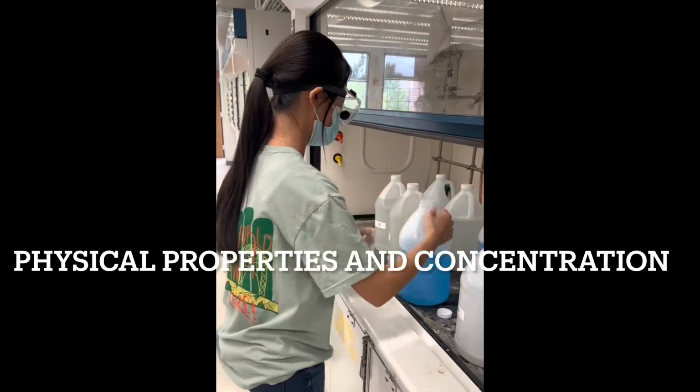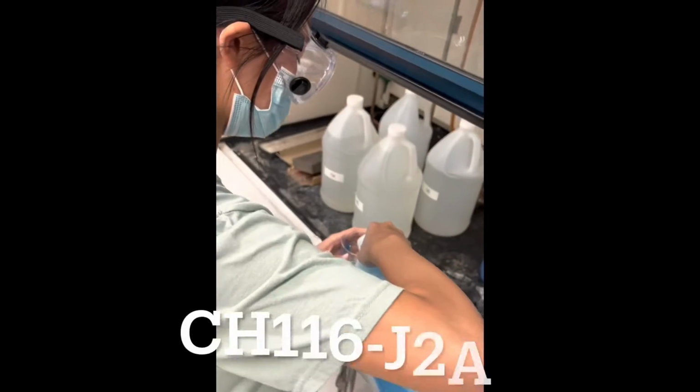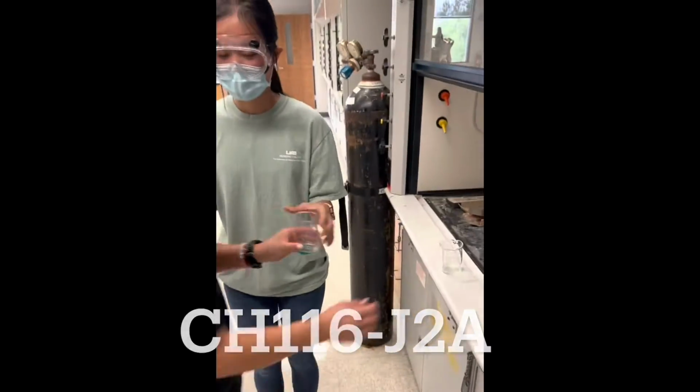The first thing we did was gather our material. We got the blue water solution, and then we got the 20% stock solution.